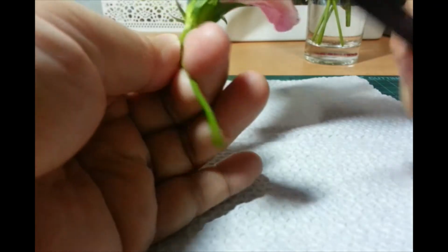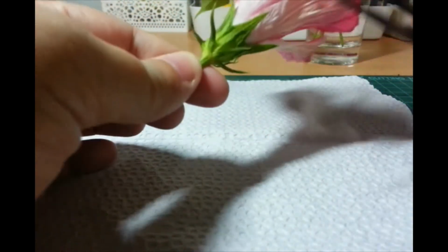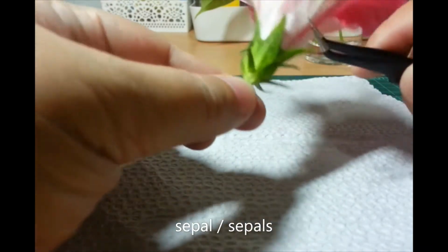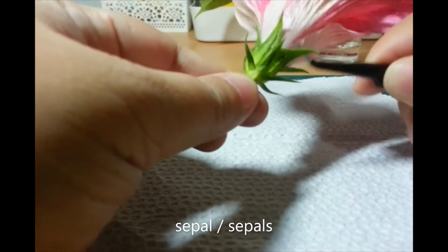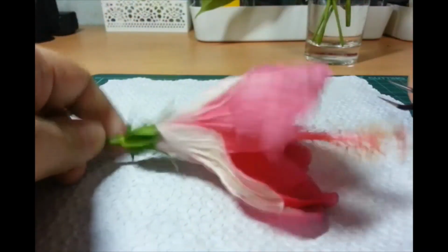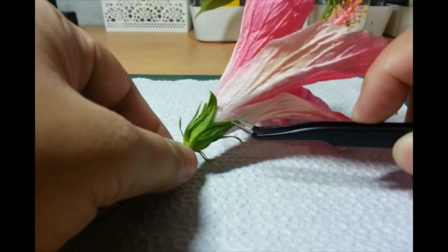Now, you also have these larger leaf-like structures called the sepals, S-E-P-A-L-S, plural. What is their function? When the flower was still a bud, the sepals protected it.